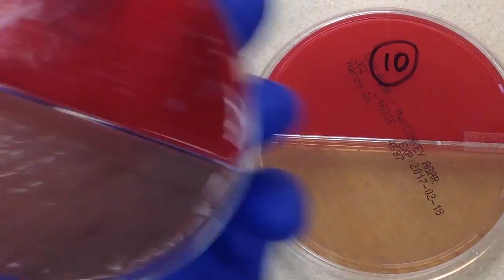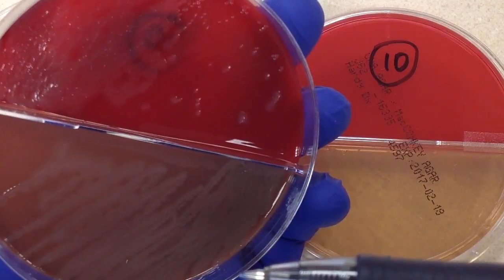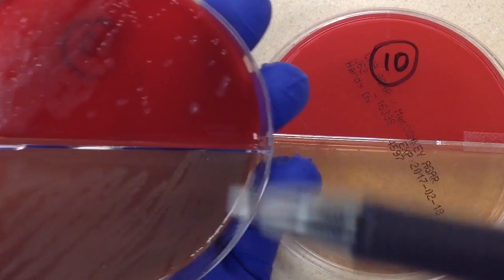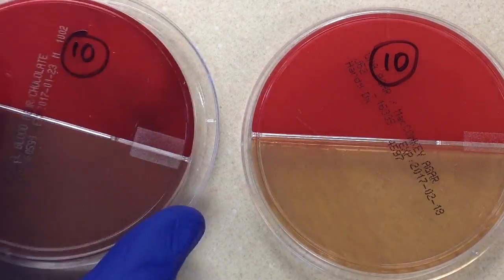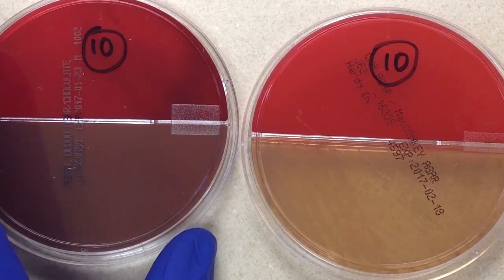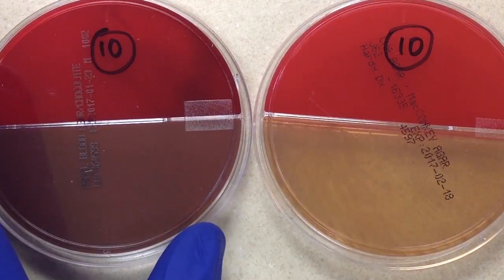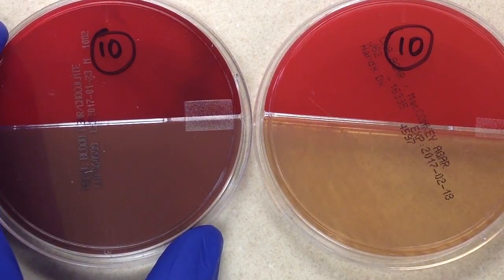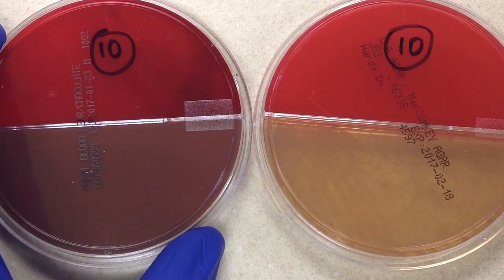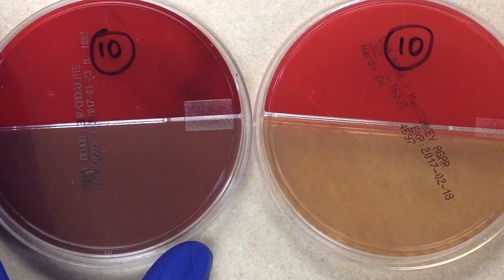We have sheep blood and chocolate. Chocolate is an enriched medium — essentially everything we're looking for pathogen-wise will grow on it. For this culture type, the common pathogens we're looking for are Streptococcus pneumoniae, Haemophilus influenzae, members of Enterobacteriaceae such as E. coli and Klebsiella pneumoniae, and possibly yeast like Candida. Staph aureus also makes its way onto the top pathogen list for many sites.